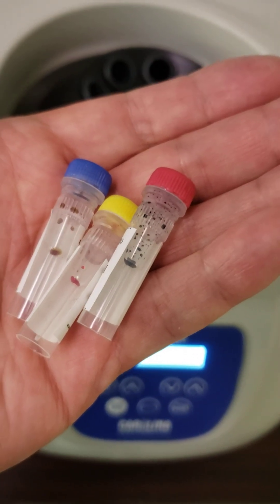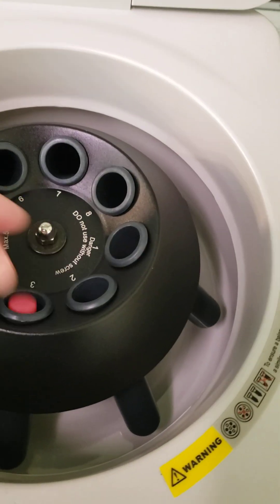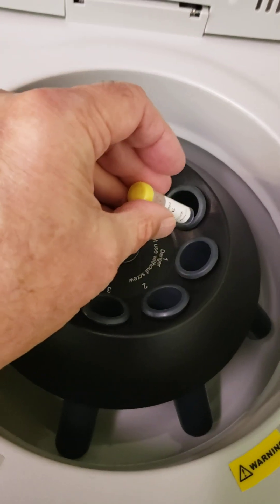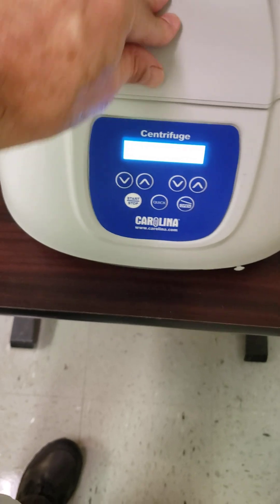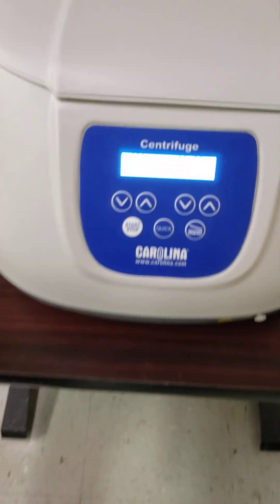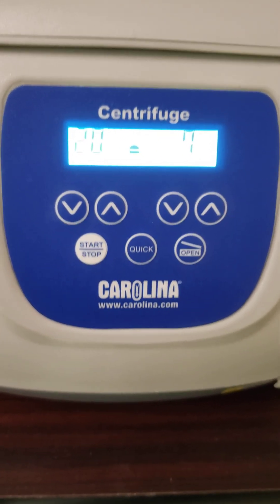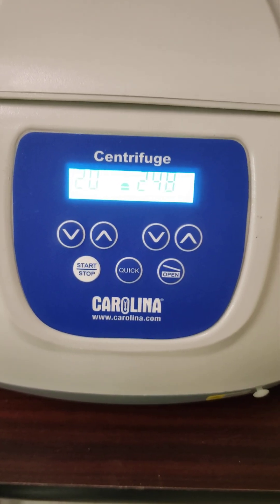Can you see how the dye is kind of scattered? We're going to drop these in roughly a triangle pattern. I'm going to close the lid and then we're just going to click start, and this only goes for 20 seconds, so it won't take that long.